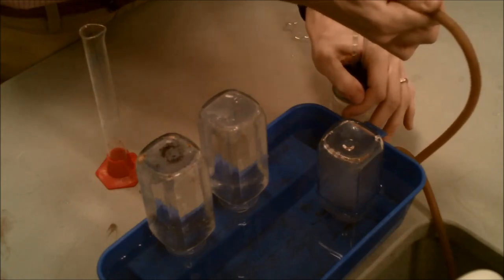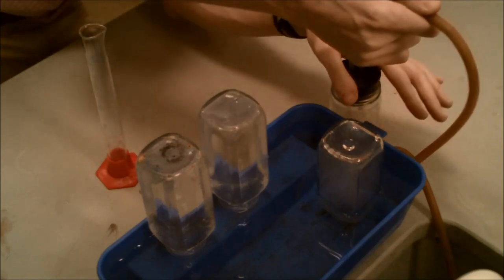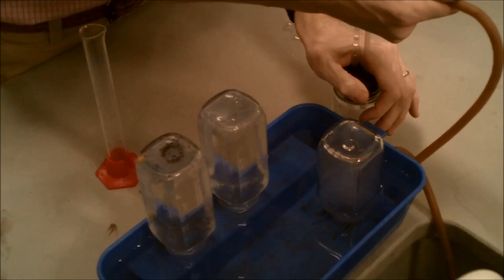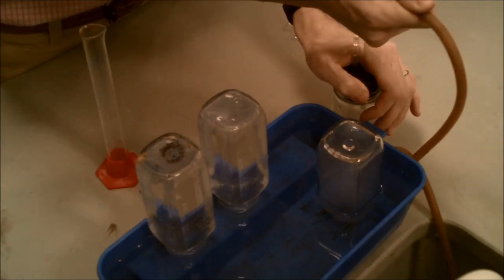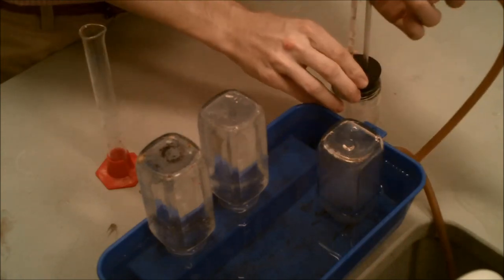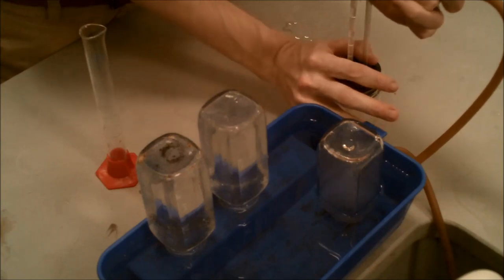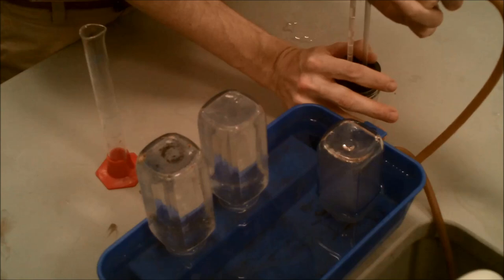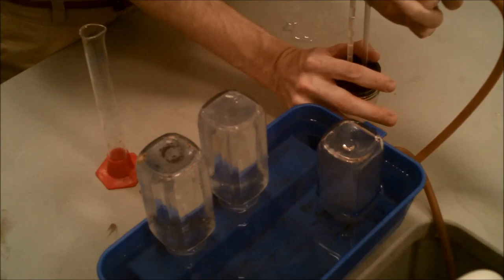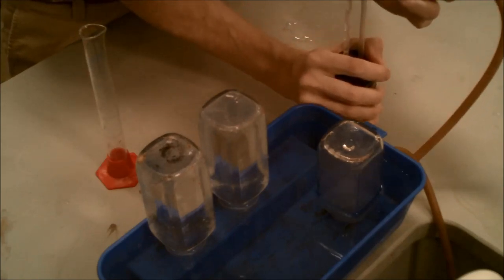So you can see the reaction was a little hard to capture all the hydrogen gas because there were some leaks in the tube. So I'm trying to keep the tube as closed as possible. And once that collection jar is completely filled with hydrogen gas, it'll move back to the shelf and we'll move the next container onto the bubbles and collect all of them, all of the bubbles in that second container. Essentially we do the same thing that we did to this first jar with all three of them. So at the end of this, we'll have three jars completely filled with hydrogen gas.